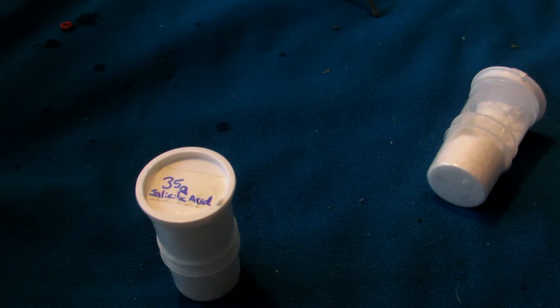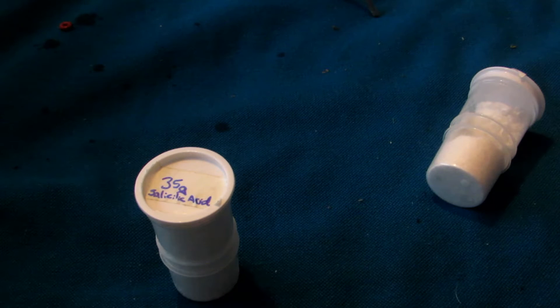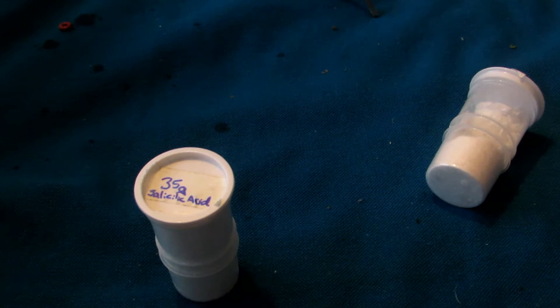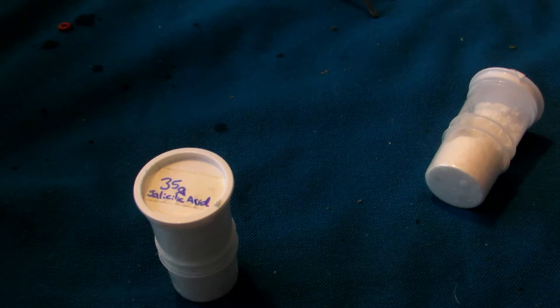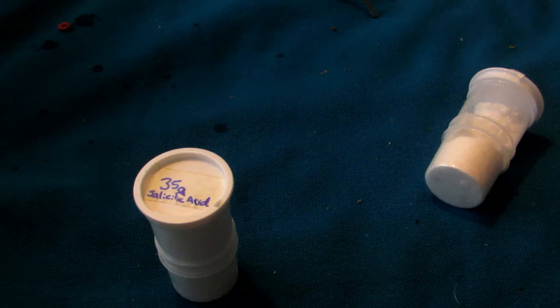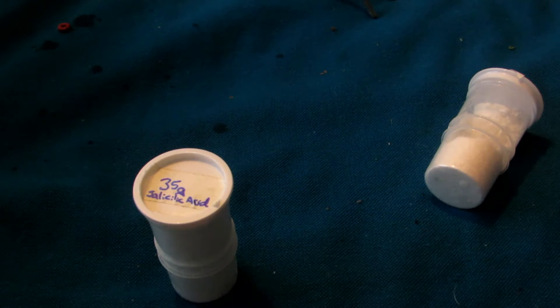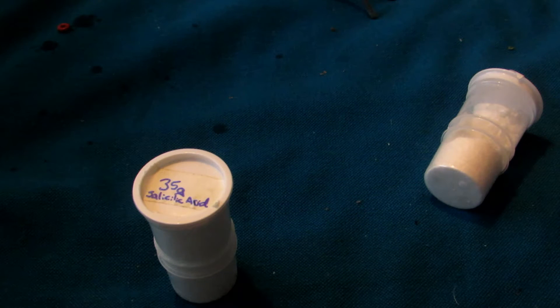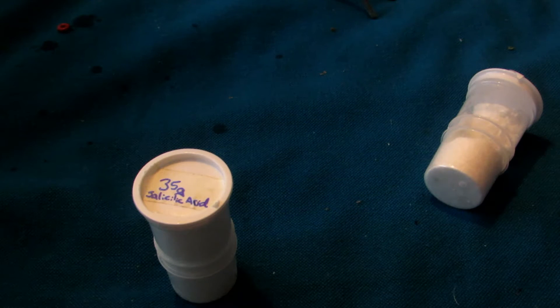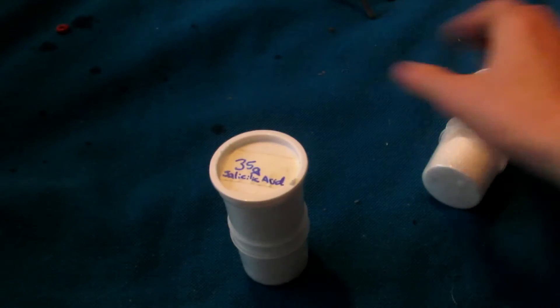Hey guys, and welcome back to another video. In our previous video, we converted acetylsalicylic acid from aspirin tablets to salicylic acid through an acid-base hydrolysis reaction, hydrolyzing the acetylsalicylic acid to salicylic acid and forming acetic acid in the process. The salicylic acid was crystallized out, and we were left with 50 grams.